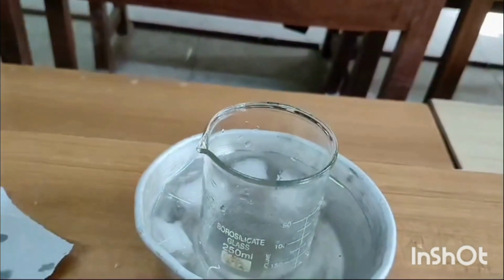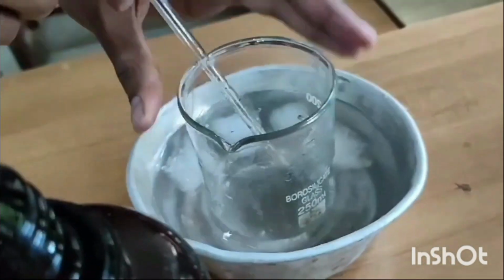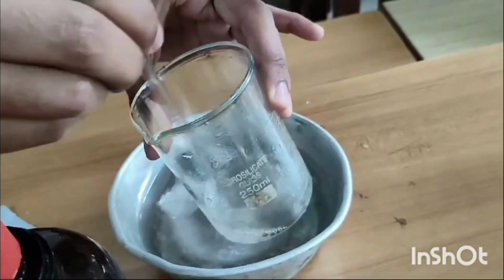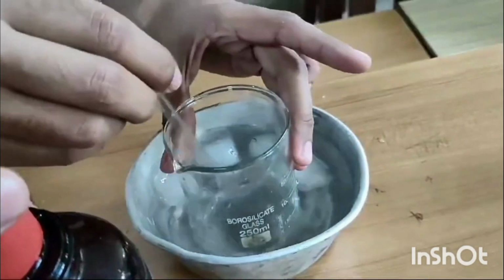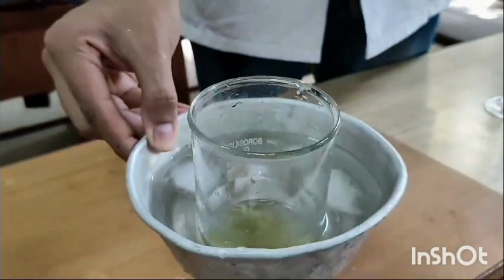We have to add concentrated sulfuric acid with the help of a dropper about 4 to 5 times, to this solution of benzophenone oxime and diethyl ether. Now we have to stir the solution alongside so that a clear solution forms, and we have to stir it for about 20 to 25 minutes. We notice the color change from white to yellow after constant stirring and constantly adding the concentrated sulfuric acid.